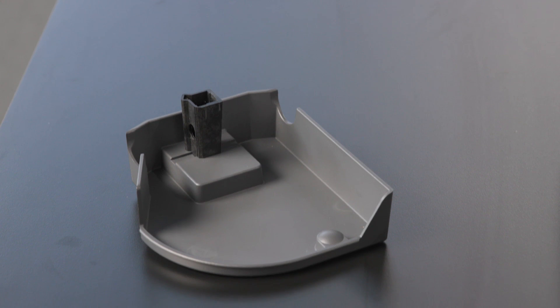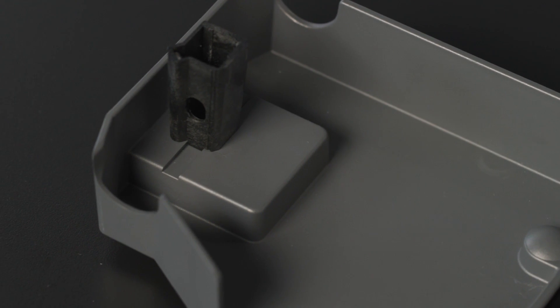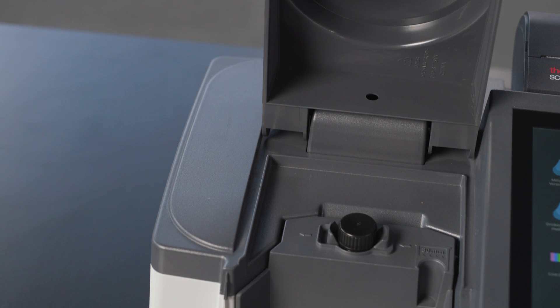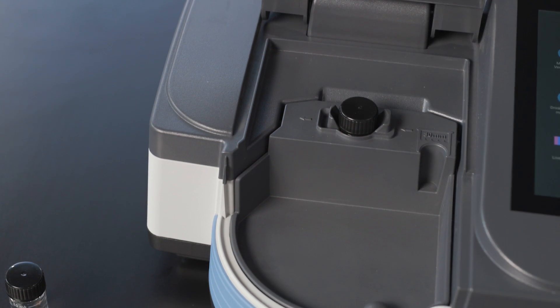There's also a holder for square 10 millimeter cells and one for rectangular cells ranging from 20 to 100 millimeters for determinations with a longer path length, so there's a lot of flexibility.